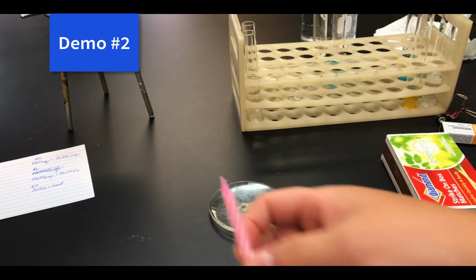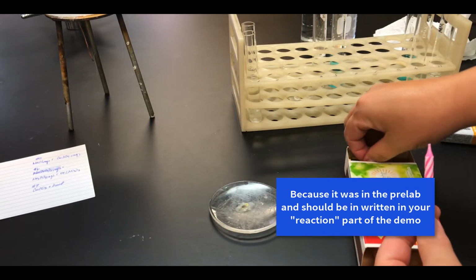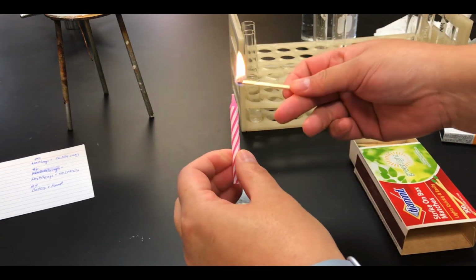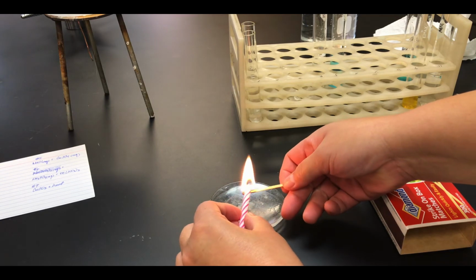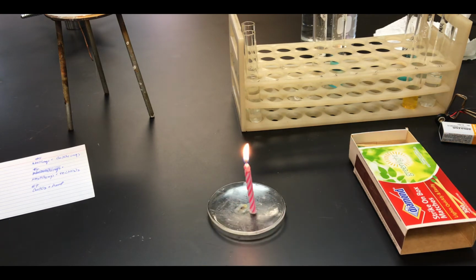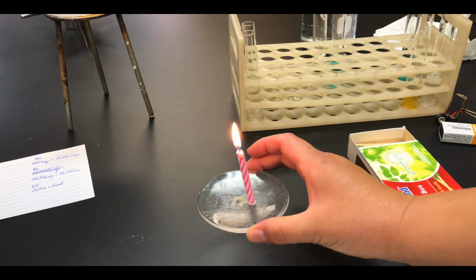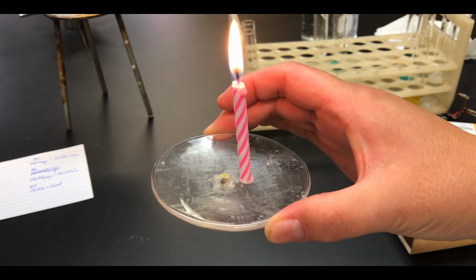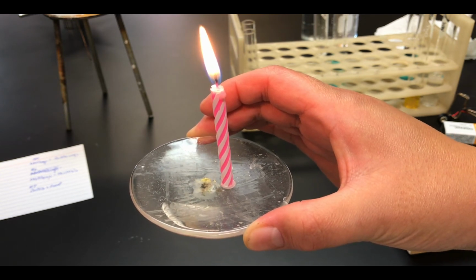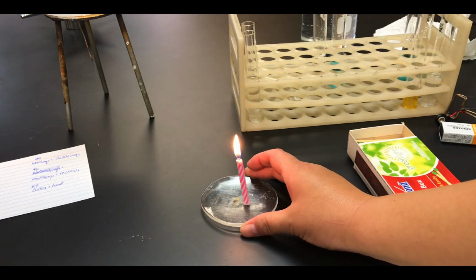Here we have a candle made primarily of wax, and now we have a match, and when we light this match, we are going to expose our candle to the flame. And clearly, I think, you can tell a reaction is occurring. Take some good observations. Here we're going to get an up-close look at what's happening. Get good observations, and we will be able to put 2 and 2 together at the end. And we'll come back and look at this candle again in a few minutes.